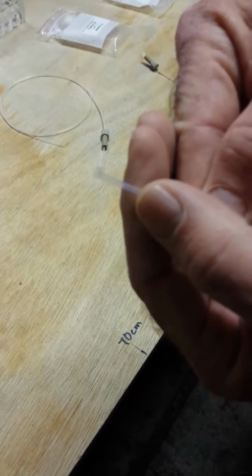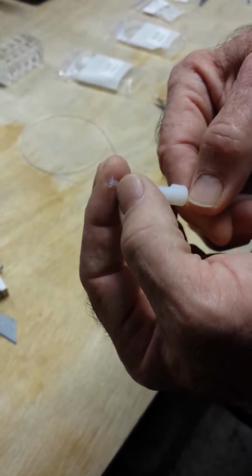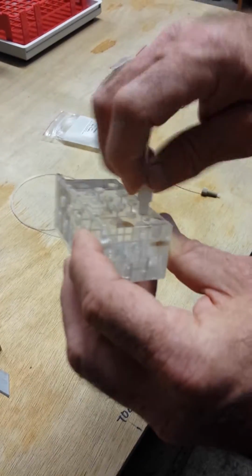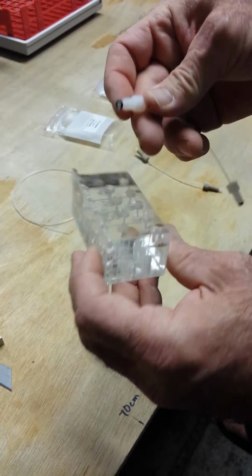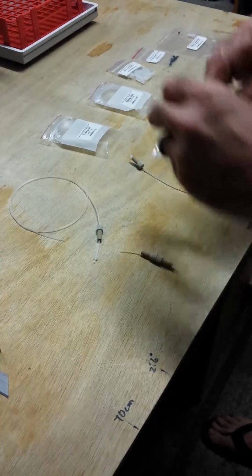But a flanged fitting, you see, is consistent and smooth. It never has a disturbance in the tubing, and it's a true finger-tight fitting. When you screw it in, you just simply lightly tighten. That's it. It seals without compressing the tubing. It comes out. Overall, it's very easy.